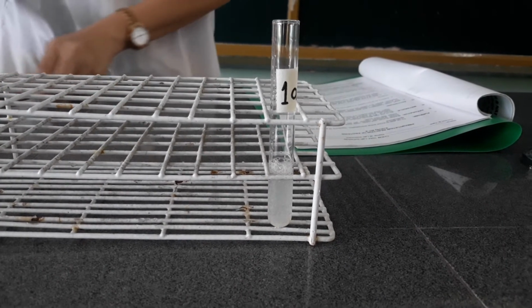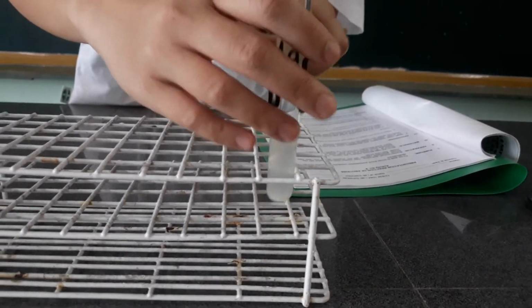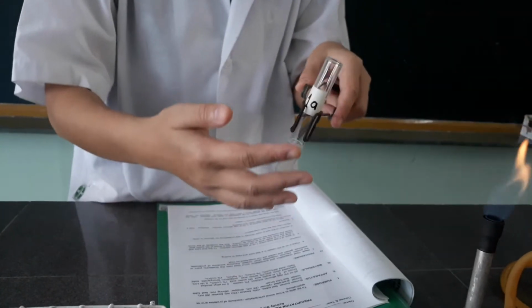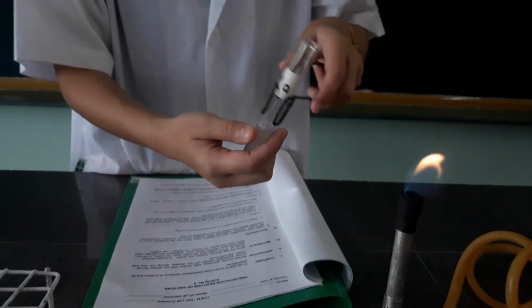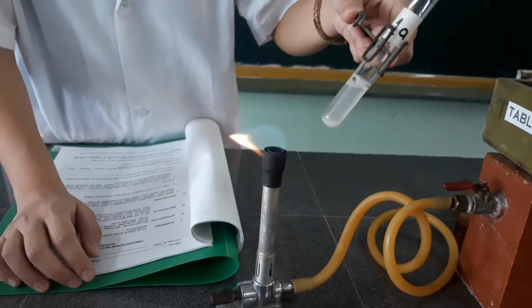Then after that, we are going to heat the test tube to boiling. In this activity, class, you will be able to know some precipitation reactions related to protein and its application in our daily lives, in industry, or related to your respective courses.